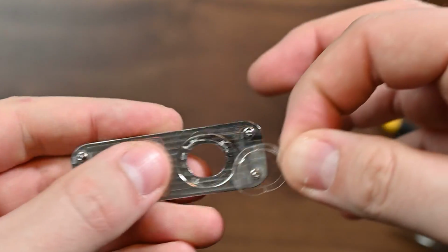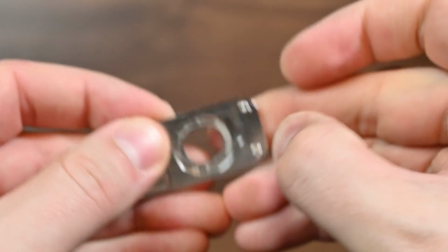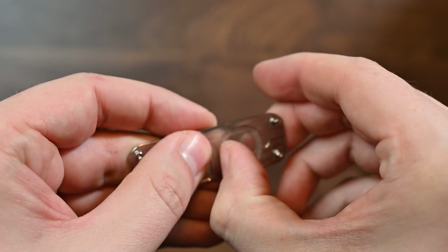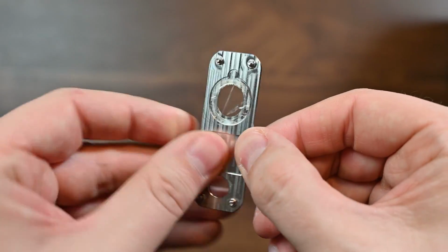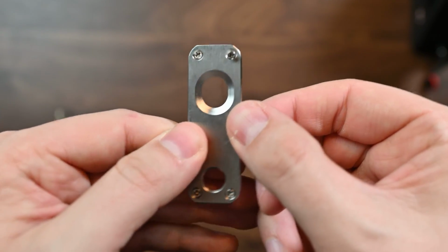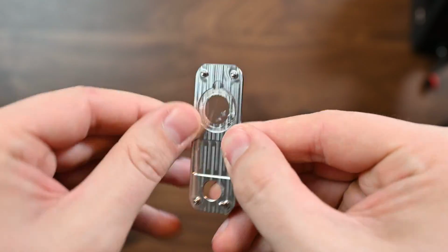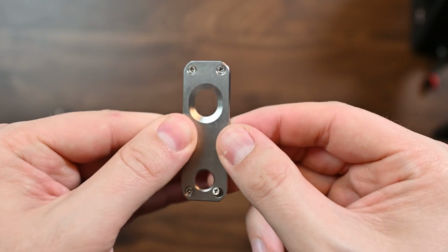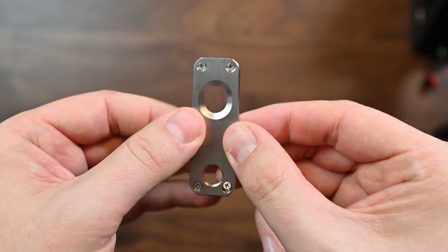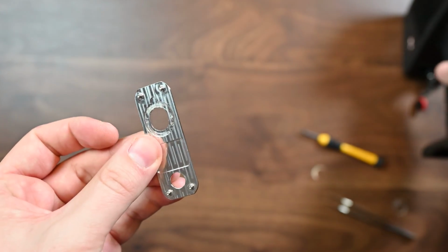So we're going to take the faceplate, and this oval is just going to align right with the window, just like that. We're going to stick it on there, and we're going to rub our finger around the outside, being careful not to rupture that window. Now you can see we have a new window in place, but look at the other side. You can't see that thick border, right? The border with the adhesive. That's important. Generally you're only looking at 6 to 8 millimeters for an X-ray beam, but we want to make sure that we have as clear a shot as possible. So that's it. Now we have to put the window back on our XRF.